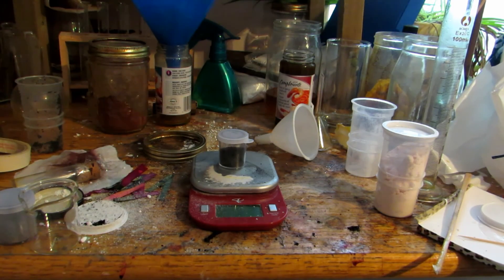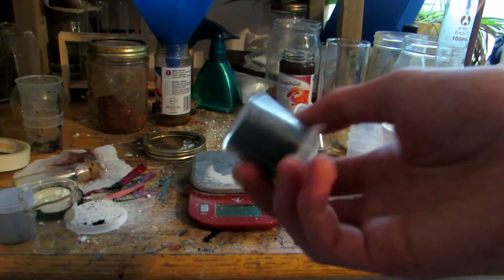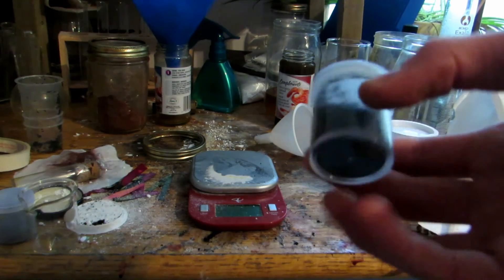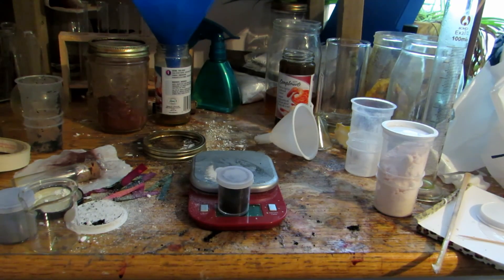So I took the carbon, crumbled it up, and washed it several times. After several water washings I simply dried it, and in between washings I made sure to crumble it up to get rid of as much residual acid as possible. One of the products is also sulfur dioxide, which leaves thousands of little air bubbles in there — we want to break those up to release all the sulfur dioxide. We are now left with a nice fine black carbon powder. There's two grams here, which is a dismal yield considering we started with ten grams of sugar. Most likely the reaction just never went to completion, so there was probably still some sugar left over that didn't fully react.